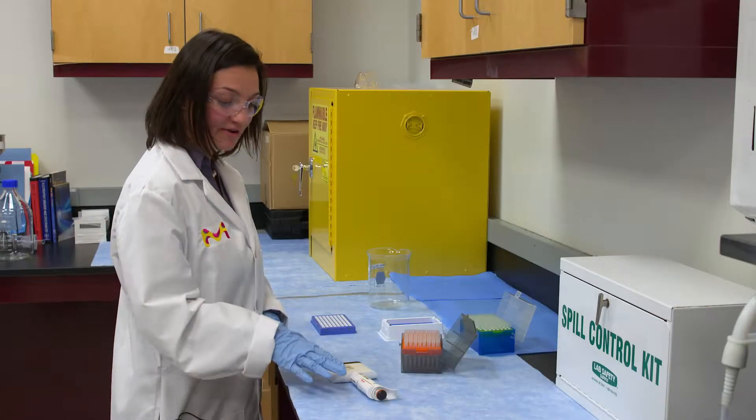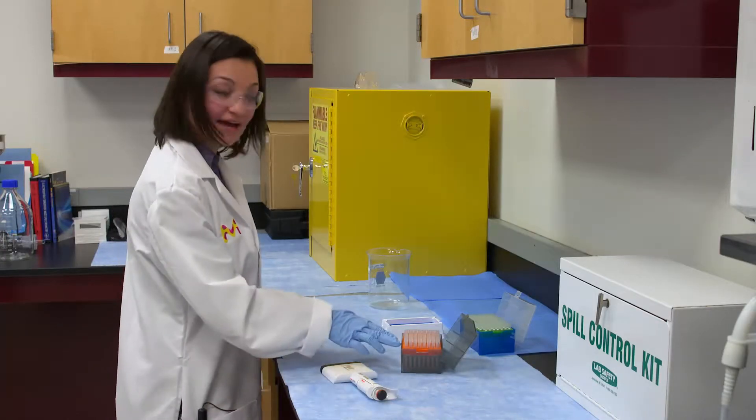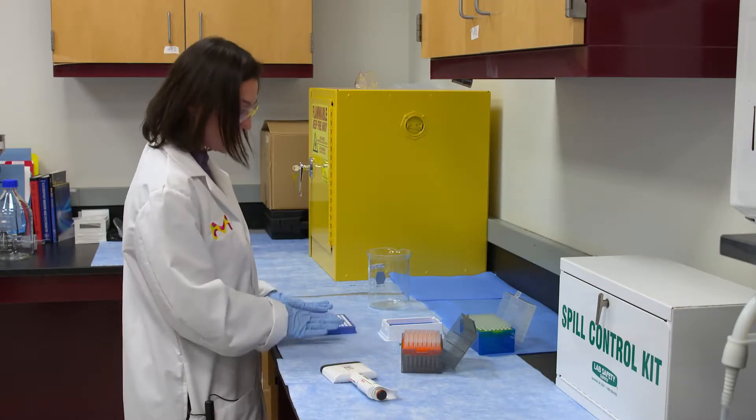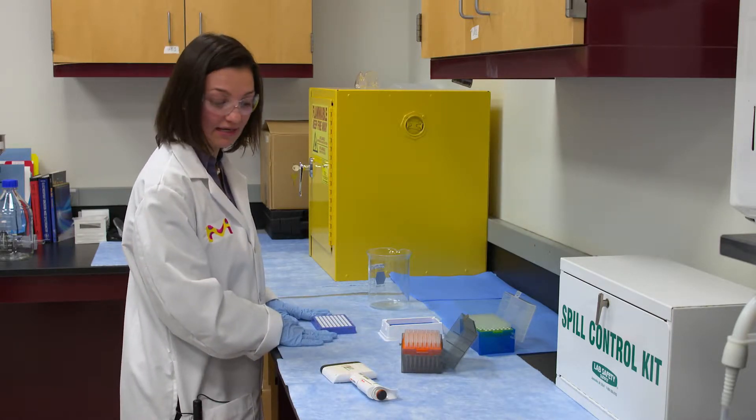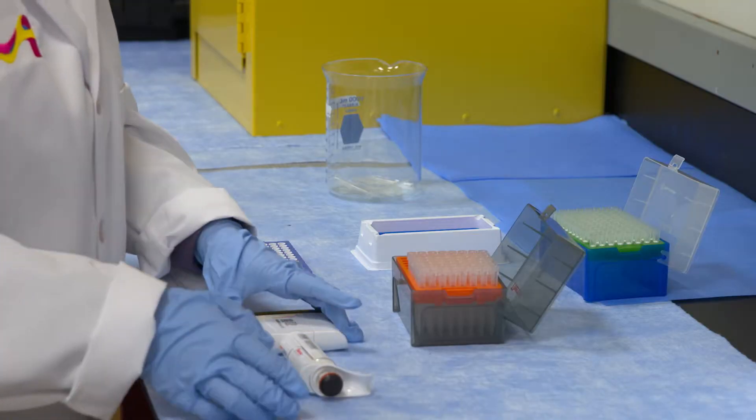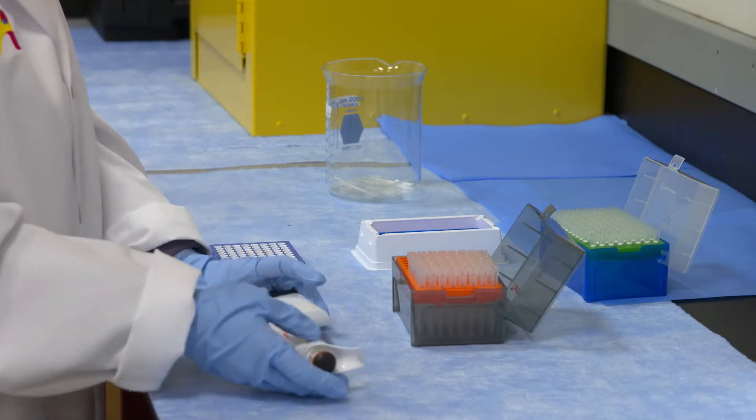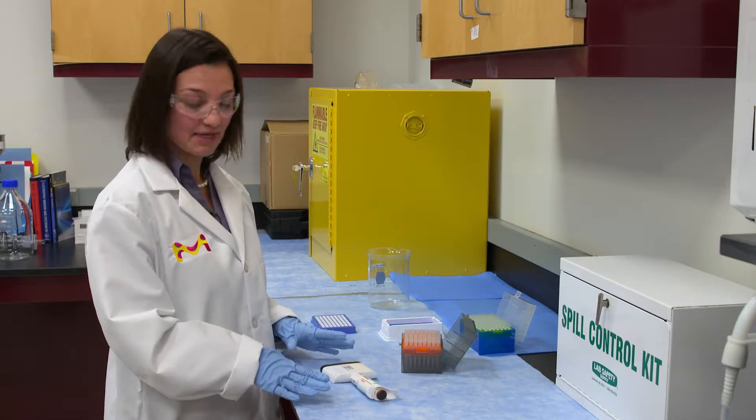So here I have a multi-channel pipetter, I have the tips, I have my reagent and I have my 96 well plate. The multi-channel pipetter is mostly used to dispense reagents in a 96 well plate all at the same time.